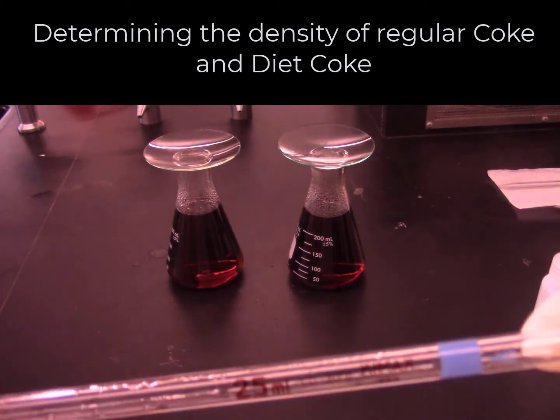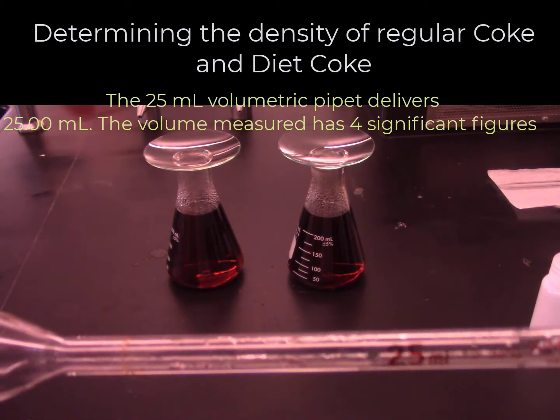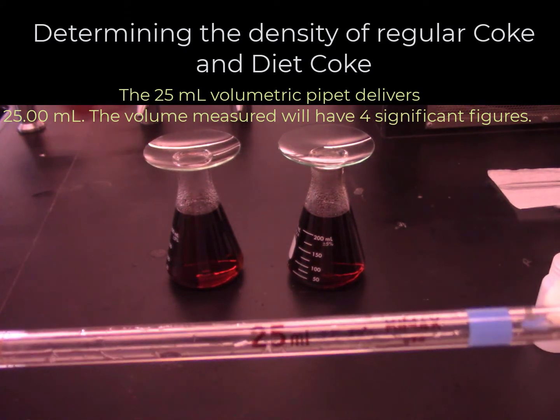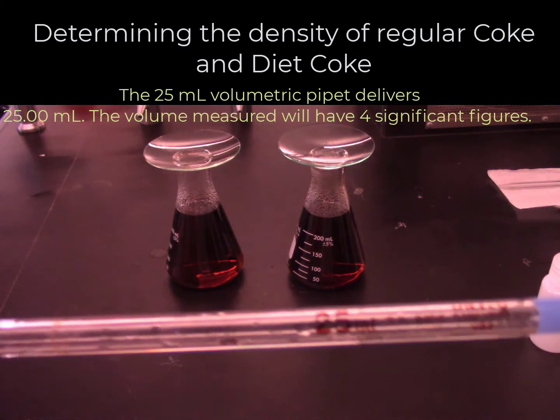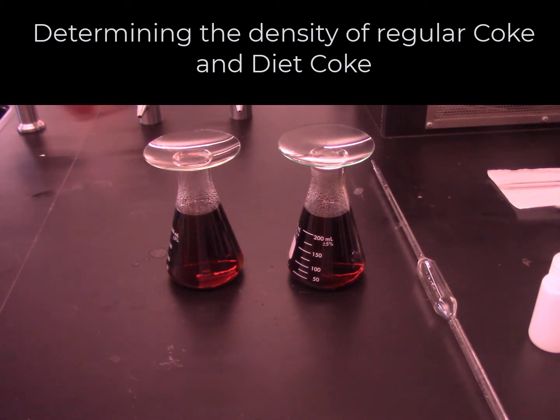This is a 25 milliliter transfer pipette that delivers 25.00 milliliters at 20 degrees centigrade. Using each method, I will analyze multiple samples from each solution and we can determine the average densities for regular Coke and Diet Coke solutions. We will have two sets of density data determined by method 1 and method 2, and we can see which method helps us to test our hypothesis unambiguously.